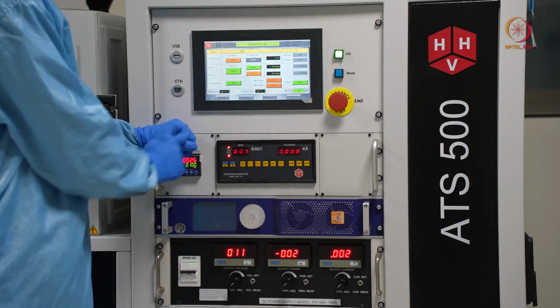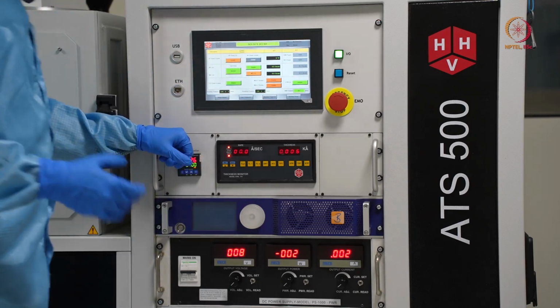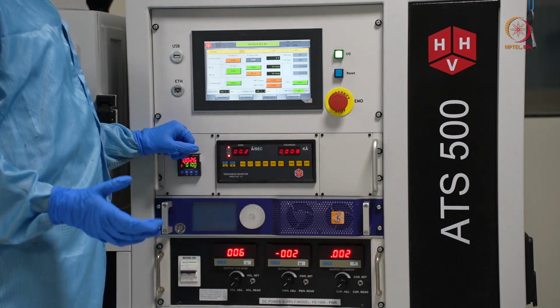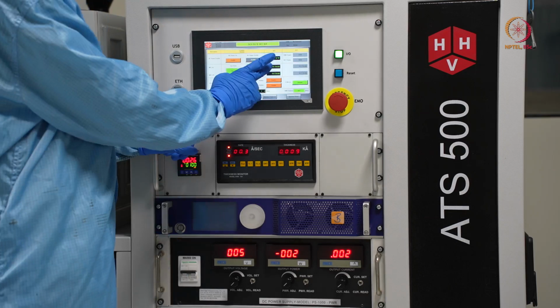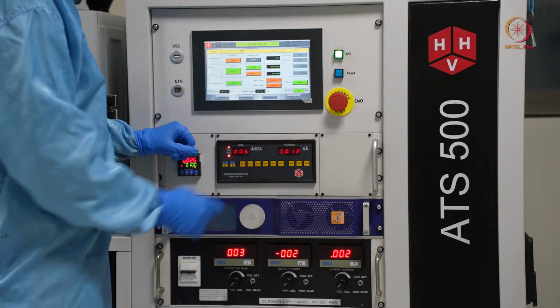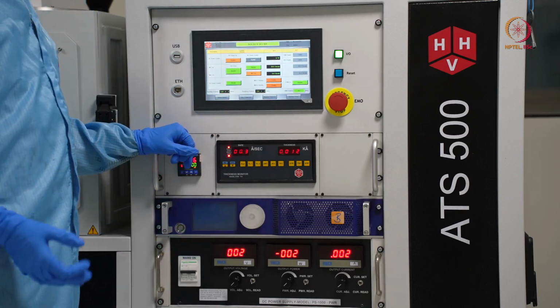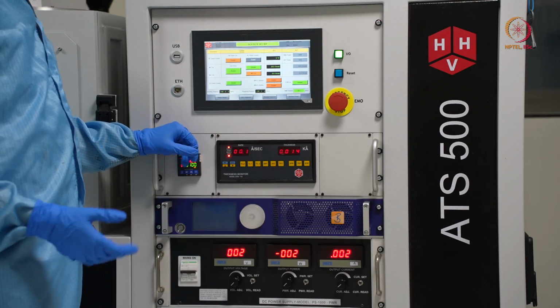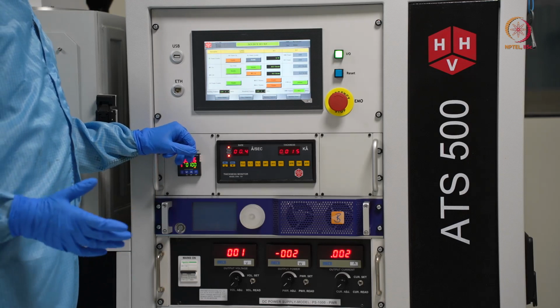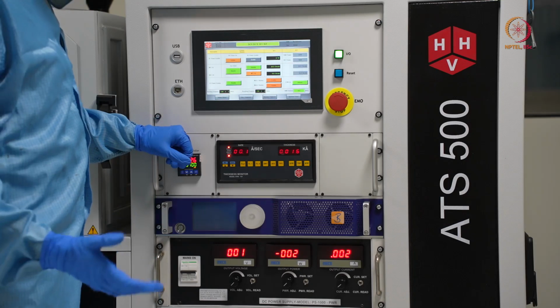for argon. If we switch it on, then we have to give how much flow we want, how many SCCM. Usually 20 to 30 can trigger a plasma, so we will try with that first. Let us say we go with 20. Actually, you can play around with the figures: if plasma is not there, you can increase the flow a little bit. It depends on your chamber conditioning and what type of material you are using. You can change the parameters accordingly.